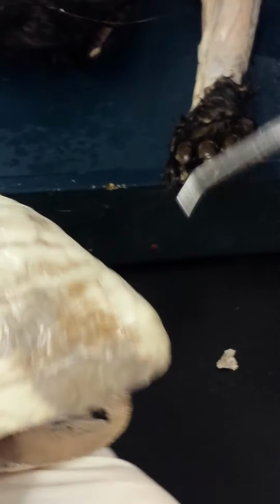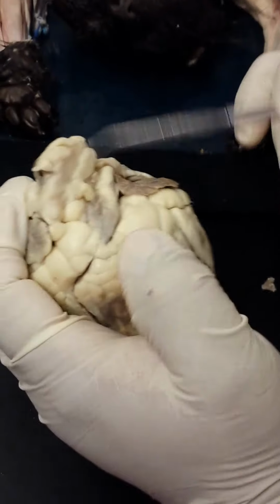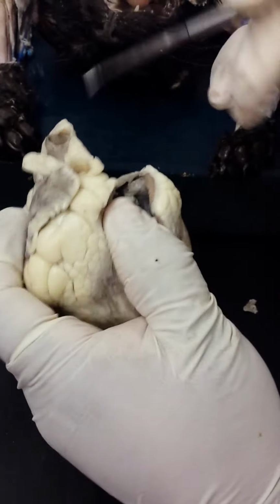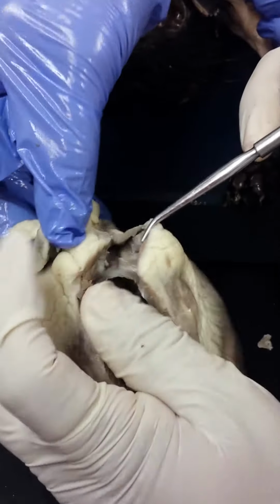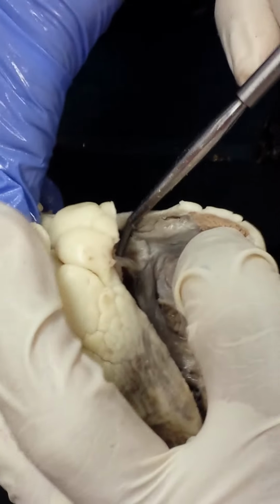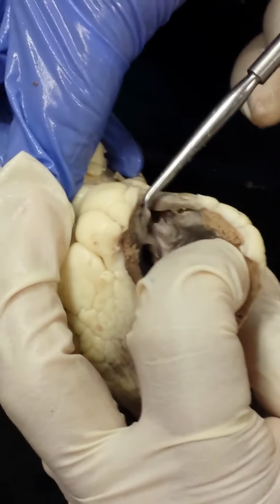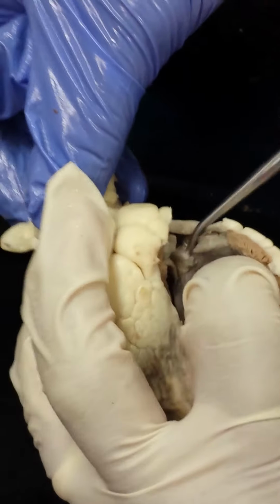You also mentioned something in the pulmonary valve. In the pulmonary trunk, when we open it up, if you hold that there, these flaps that you're seeing here are the pulmonary semilunar valves. They wouldn't be down there. These you would see visible with this type of incision.